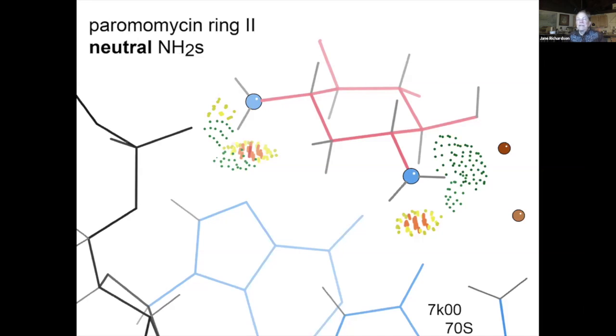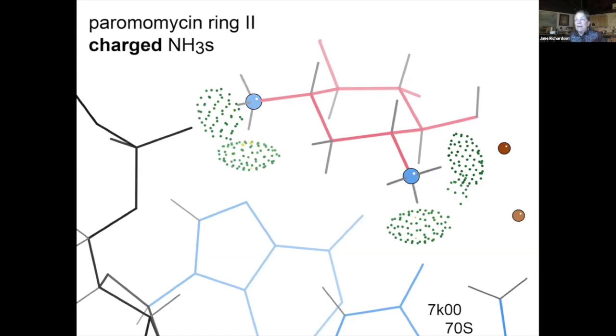And for instance, aminoglycoside antibiotics are neutral in the dictionaries, and spermidine is neutral. And so when you look at one of the rings in this antibiotic with neutral nitrogens, it's not great. If you then go and put proper NH3s in on the right places, then you get really great hydrogen bonding.